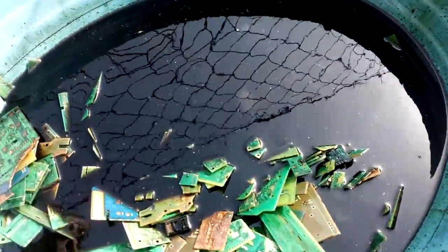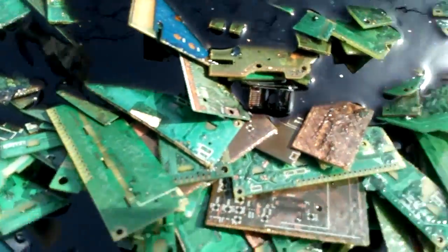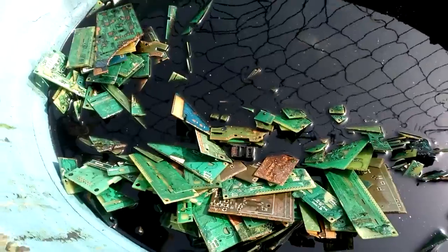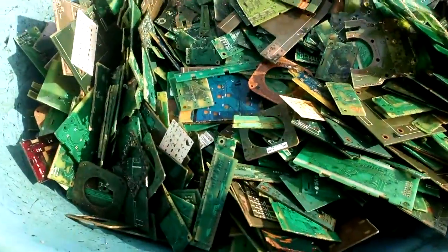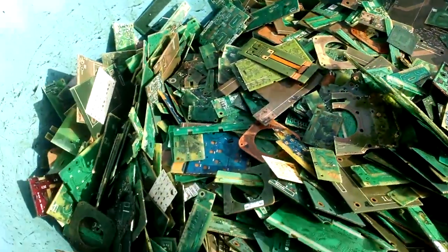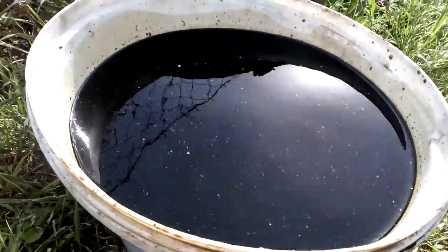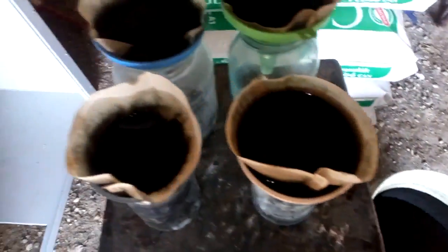This is our solution, this is our board — all gold is removed. I got a little stubborn gold but I'll remove that with the toothbrush later. Now I will drain the solution and get the gold. The board is mostly clean, maybe five percent left, but I'll remove that with the toothbrush. This is a 12 liter bucket and it's a lot of AP to filter.